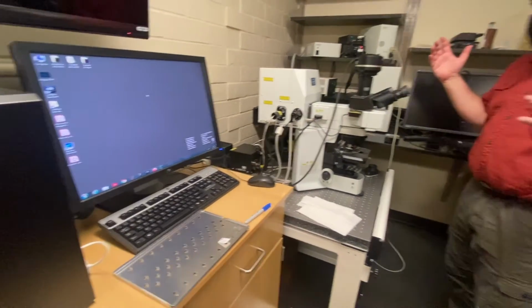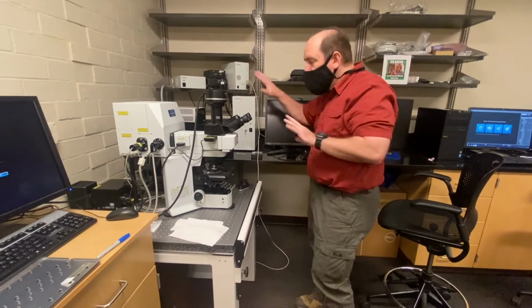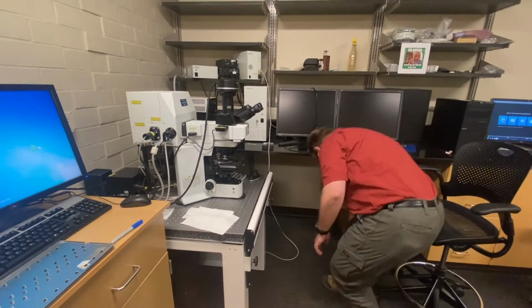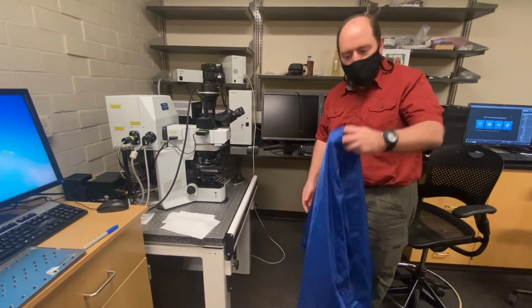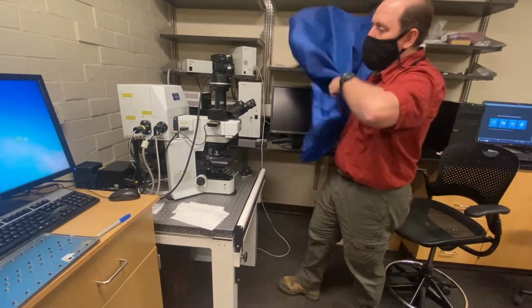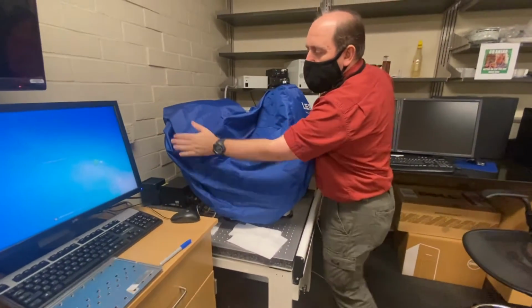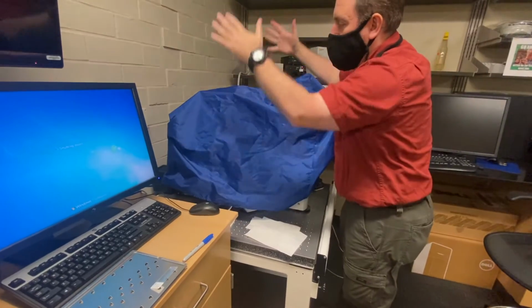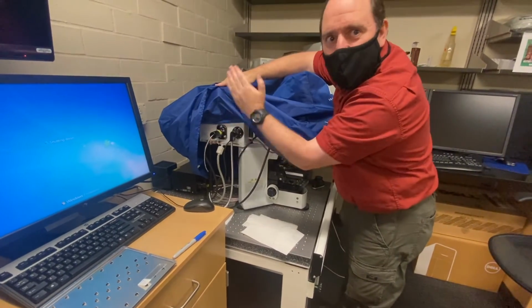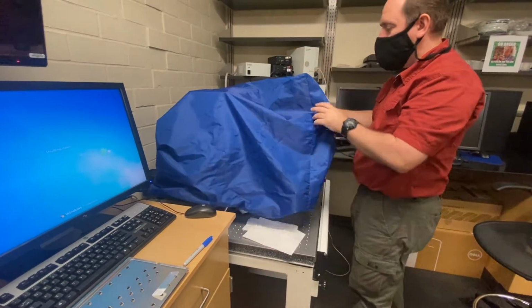Final step. The computers are shut down, the lasers are turned off, the microscope is turned off. Let's make sure we're not going to get dust in this thing. So we'll put the dust cover back on, and you have to be extremely gentle on this side, because if you were trying to flatten this out, you might actually with your hand hit the fiber optic cable and put a dent or a nick in it.